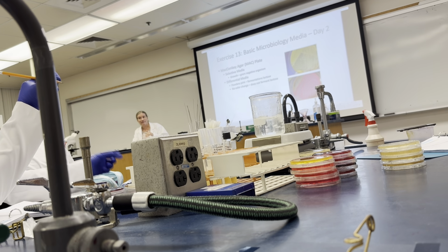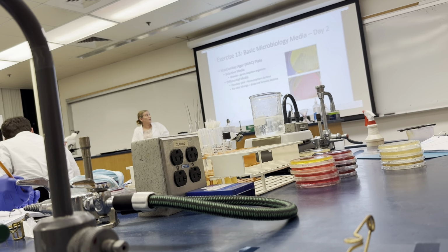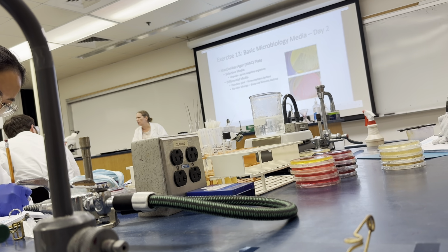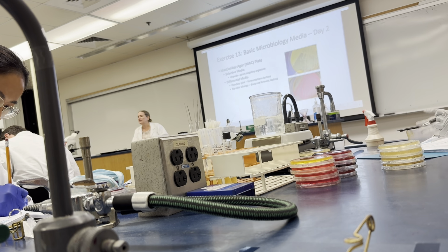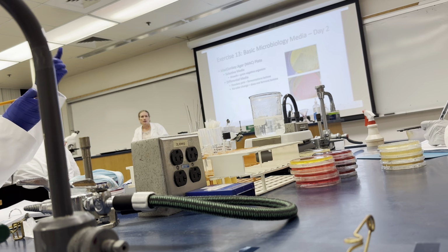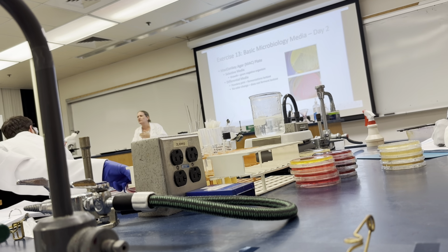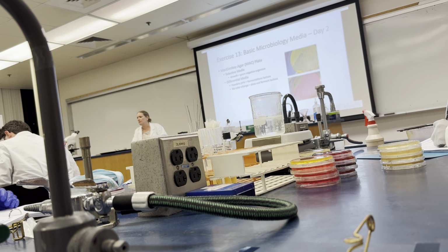E. coli turns a powdery pink. The other one has no color change, or sometimes it actually looks a little like a yellowish color change, but that's not the reaction we're looking for. It does change somewhat from the original color due to the end products of its growth on that media, but that is still not what we're looking for. We're looking for that powdery pink color.